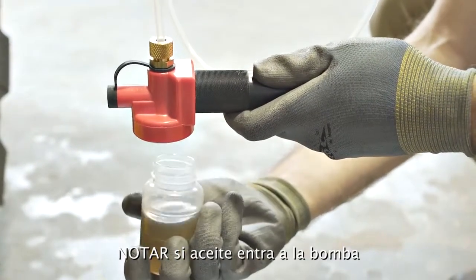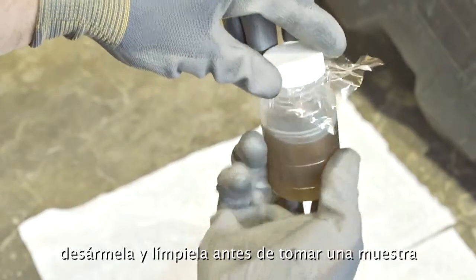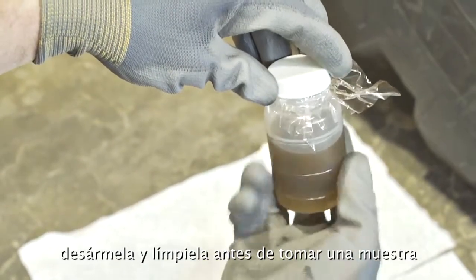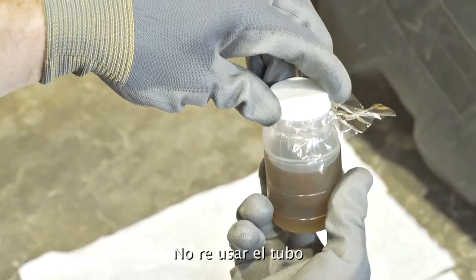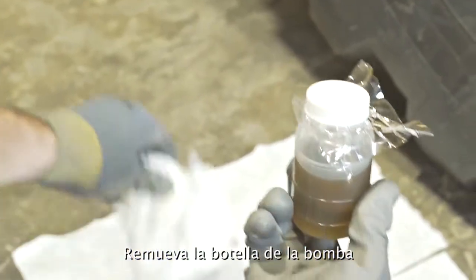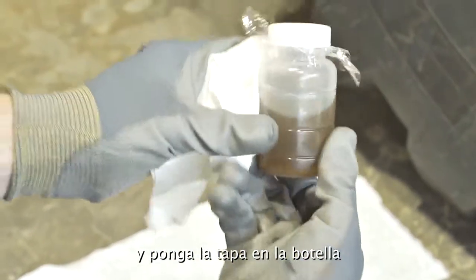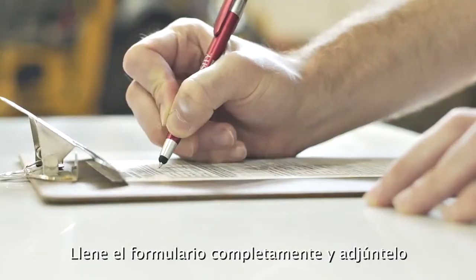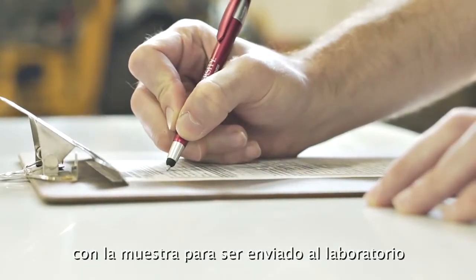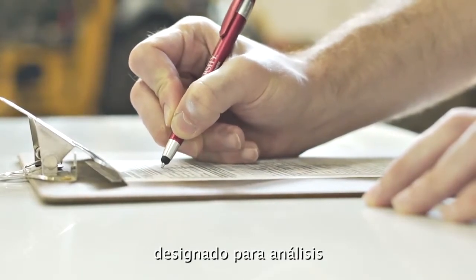Note: if oil enters the pump, disassemble and clean it before taking the sample. Do not reuse tubing. Remove the bottle from the vacuum pump and secure the cap on the bottle. Fill out the sample information form completely and submit the form and sample to the designated regional lab for testing.